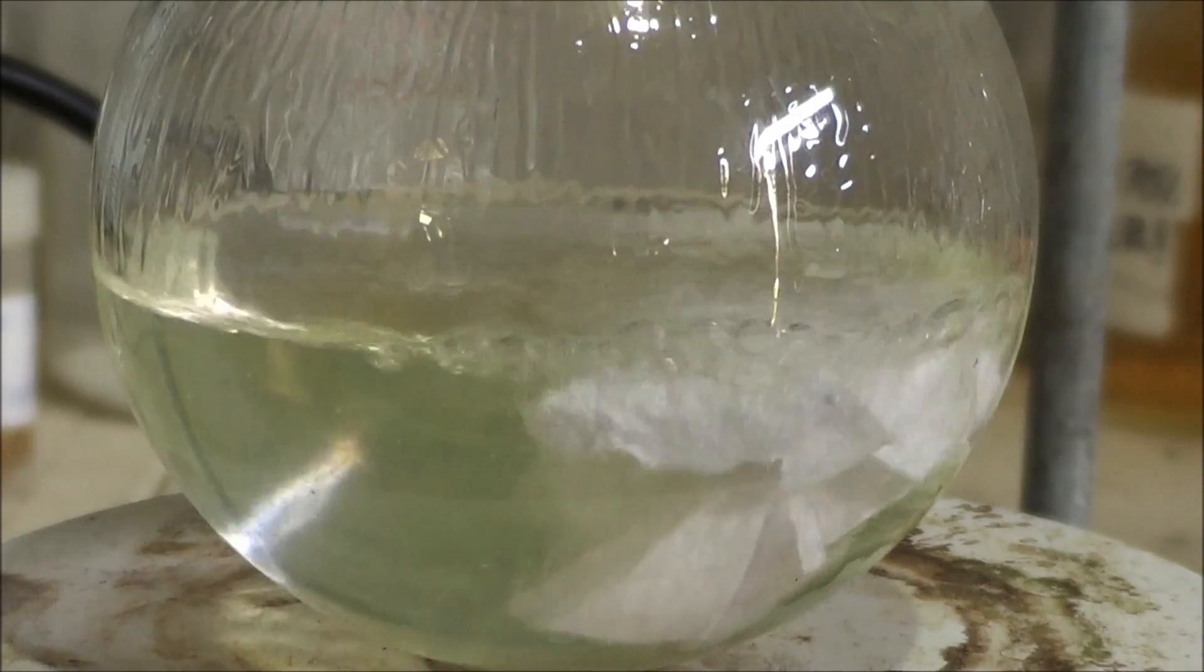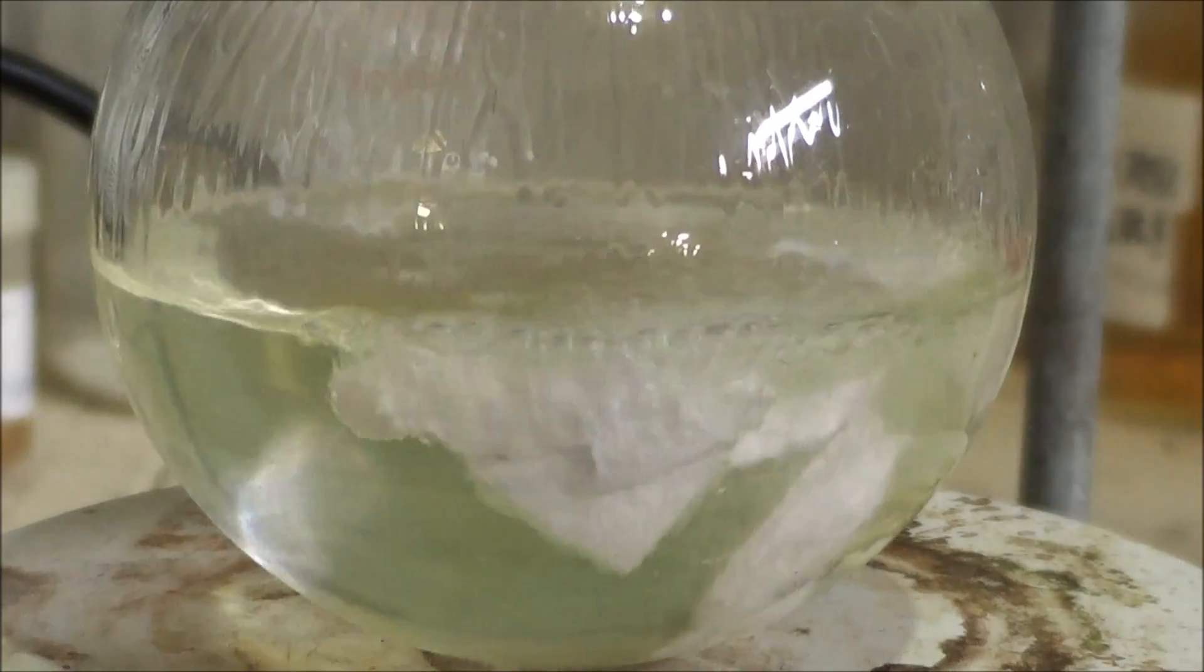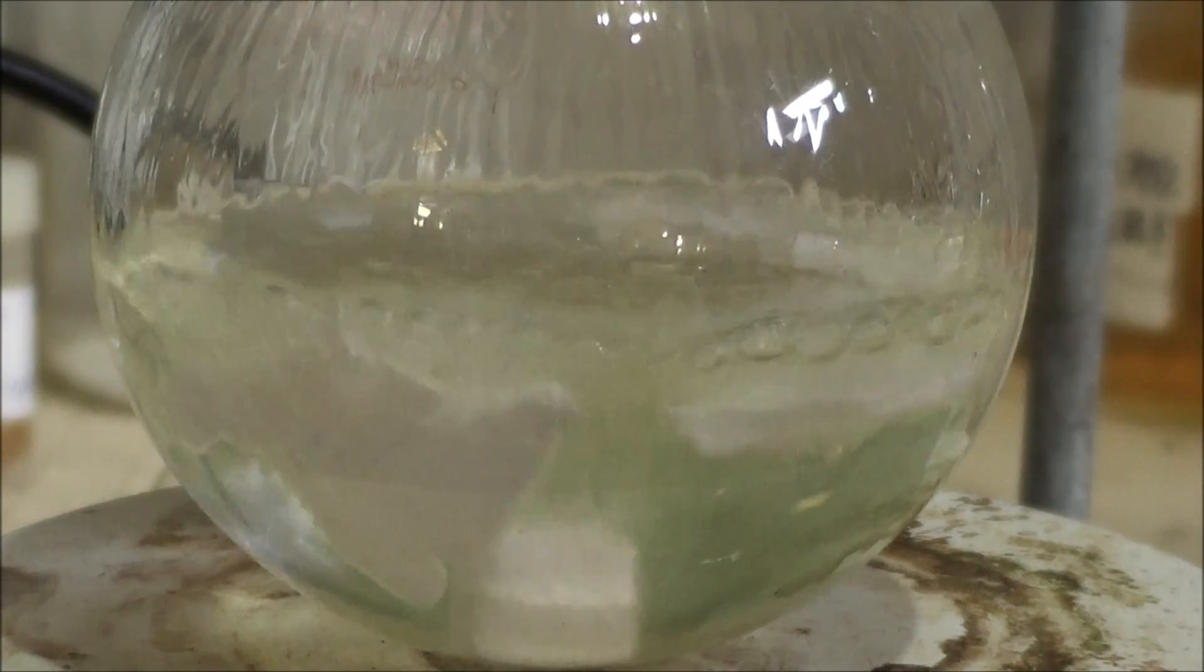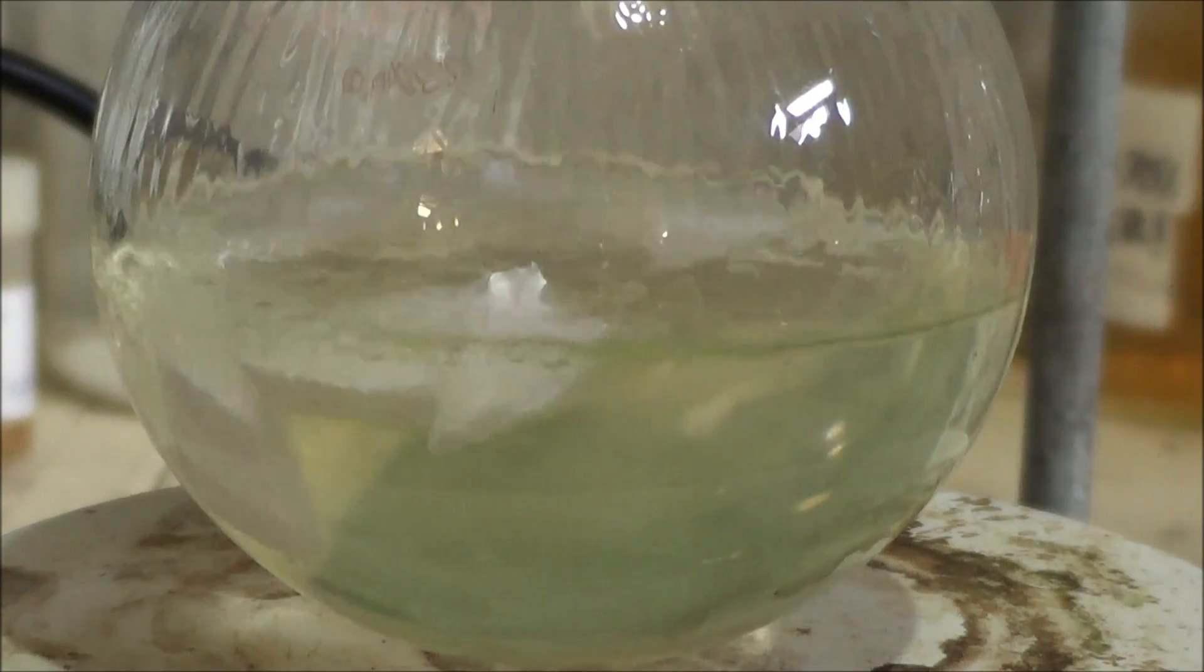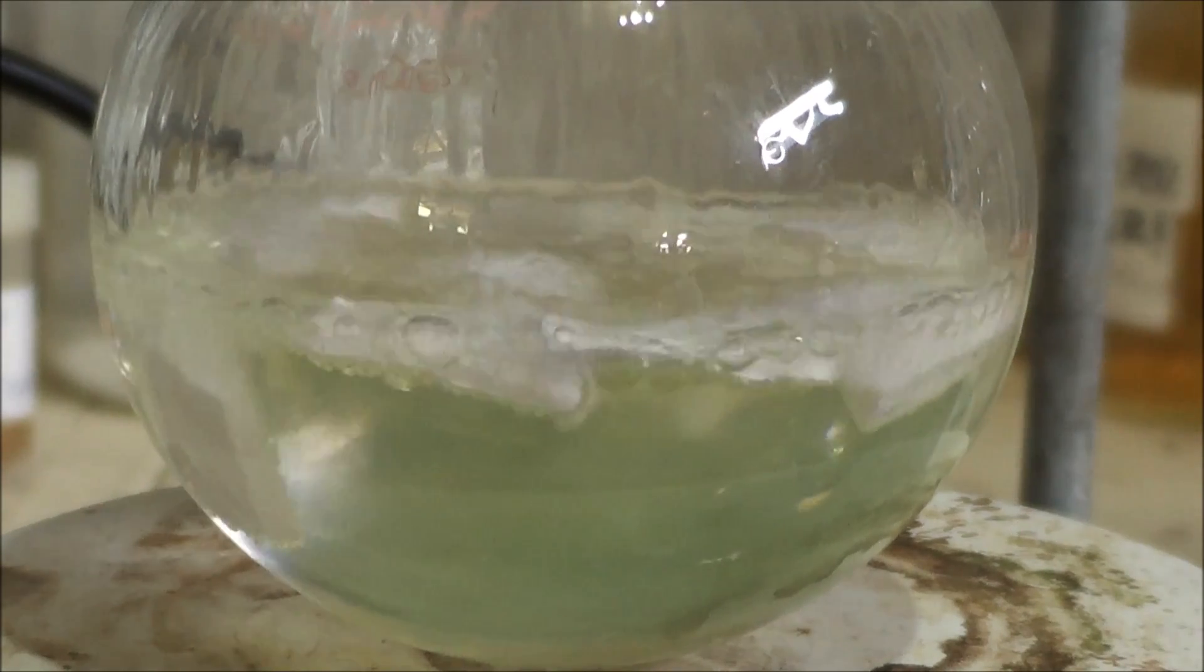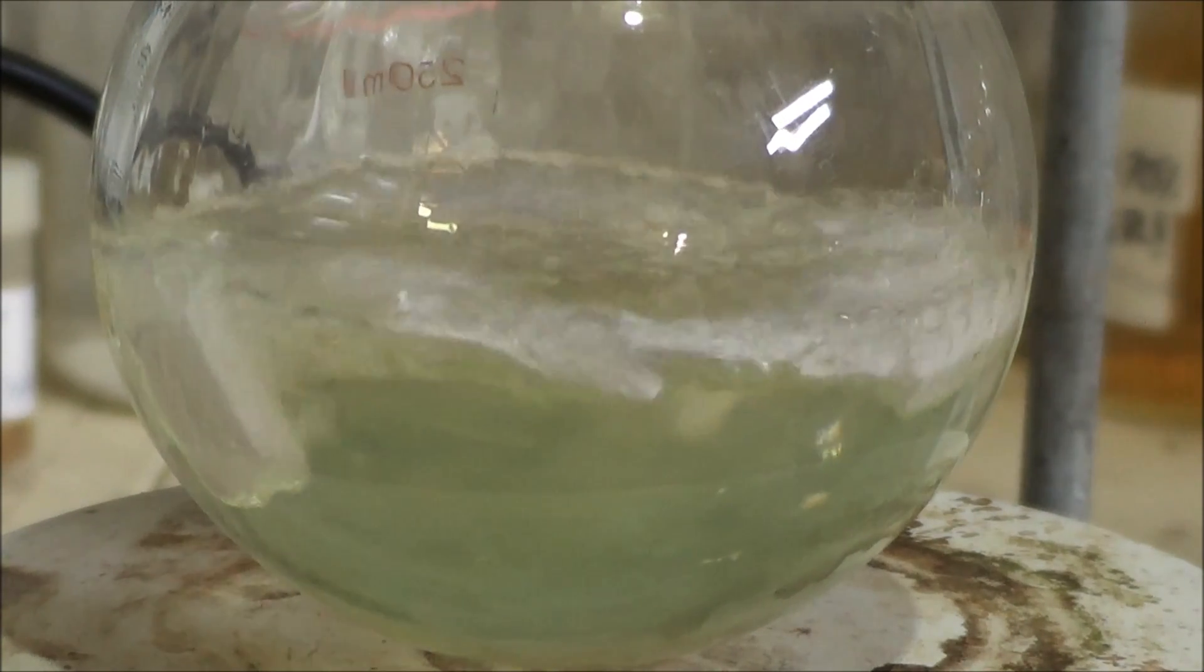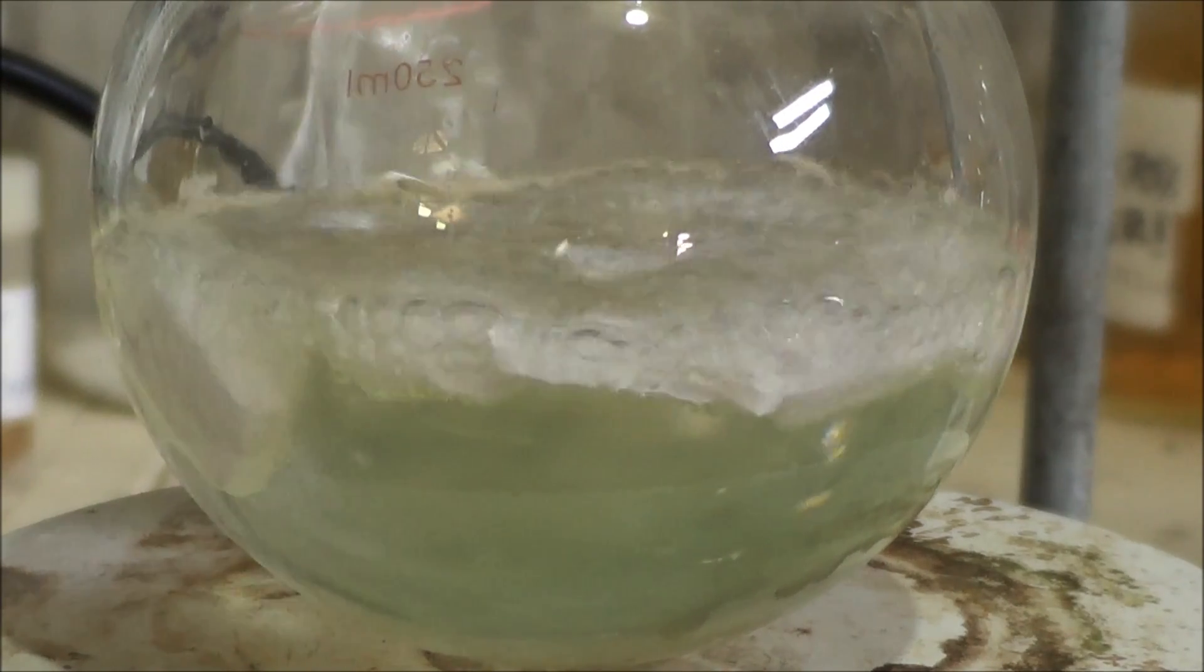It's taken on a slight greenish tinge for, I don't know, some reason. Because the chemistry just likes to do things sometimes. But yeah, it's only reacting pretty nicely in there. Definitely needed a condenser. See the hydrogen coming off and the ethanol dripping back down to the side of the flask. And yeah, we'll just let this do this thing for, I don't know how long it's going to take, maybe half an hour.